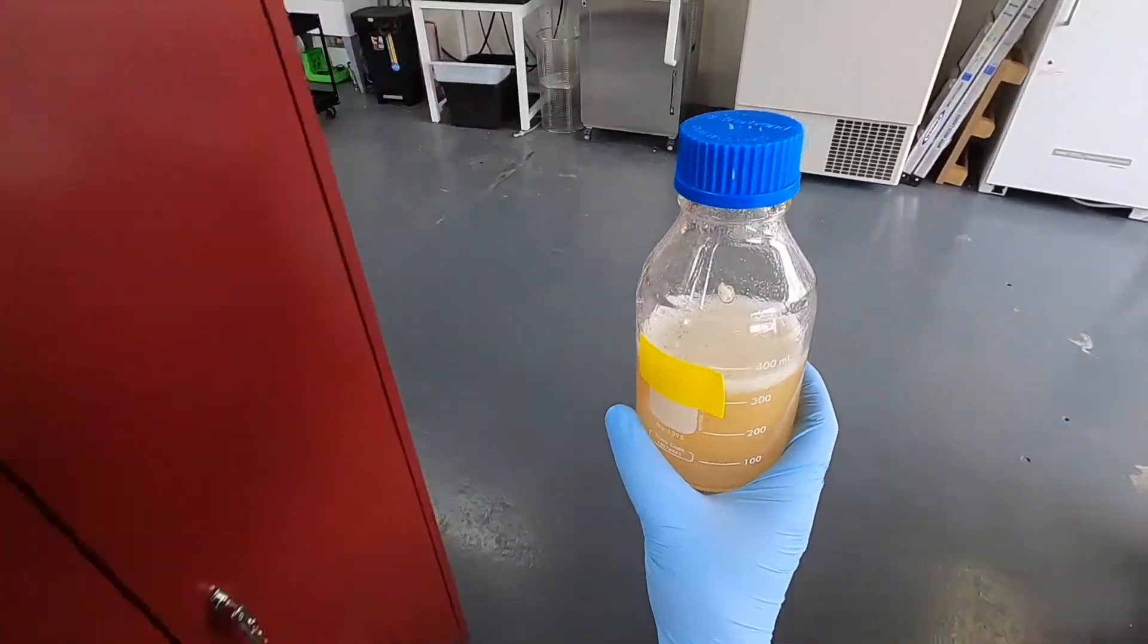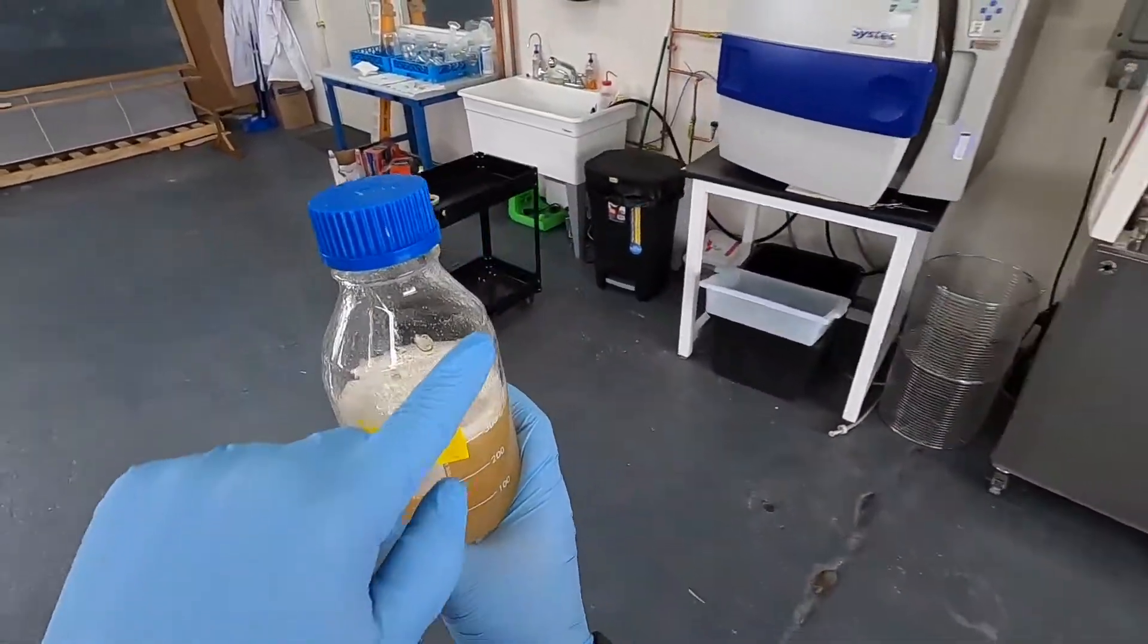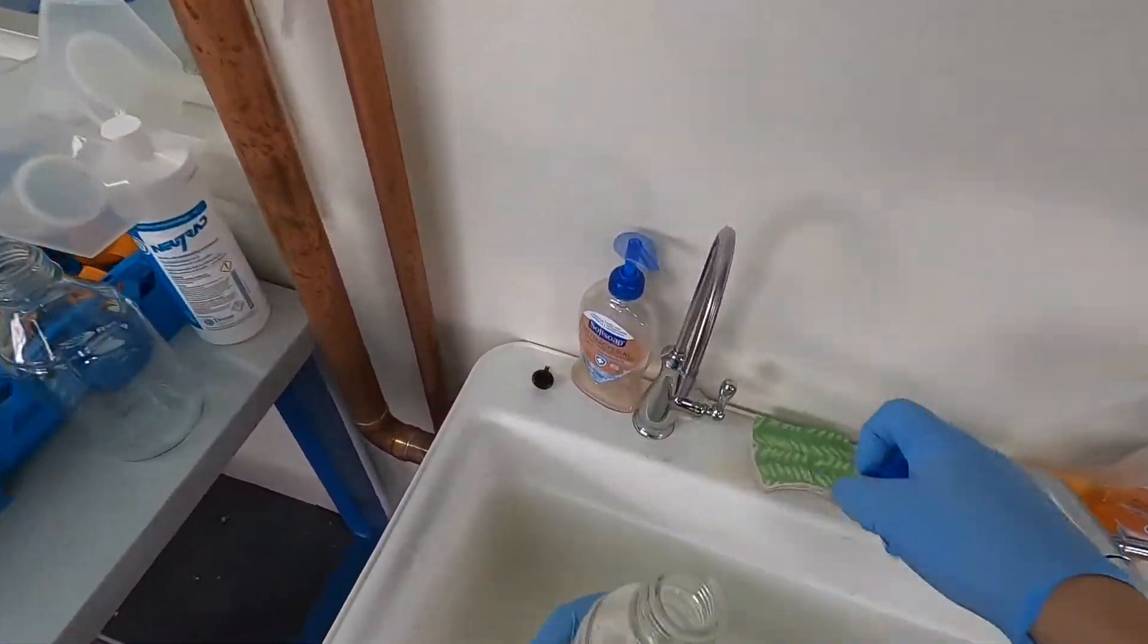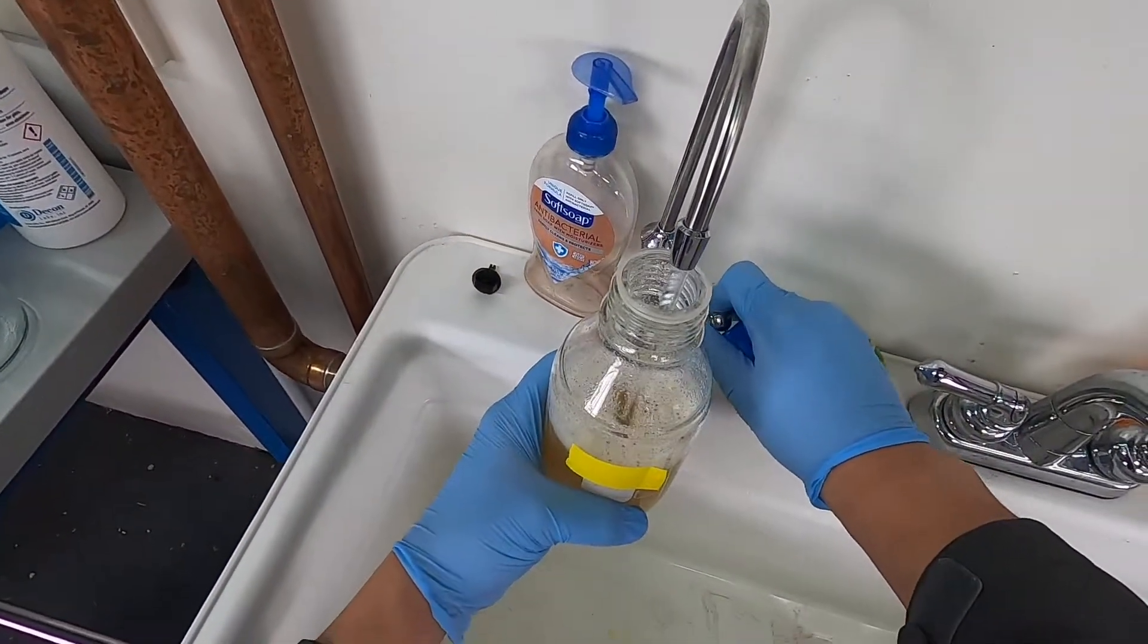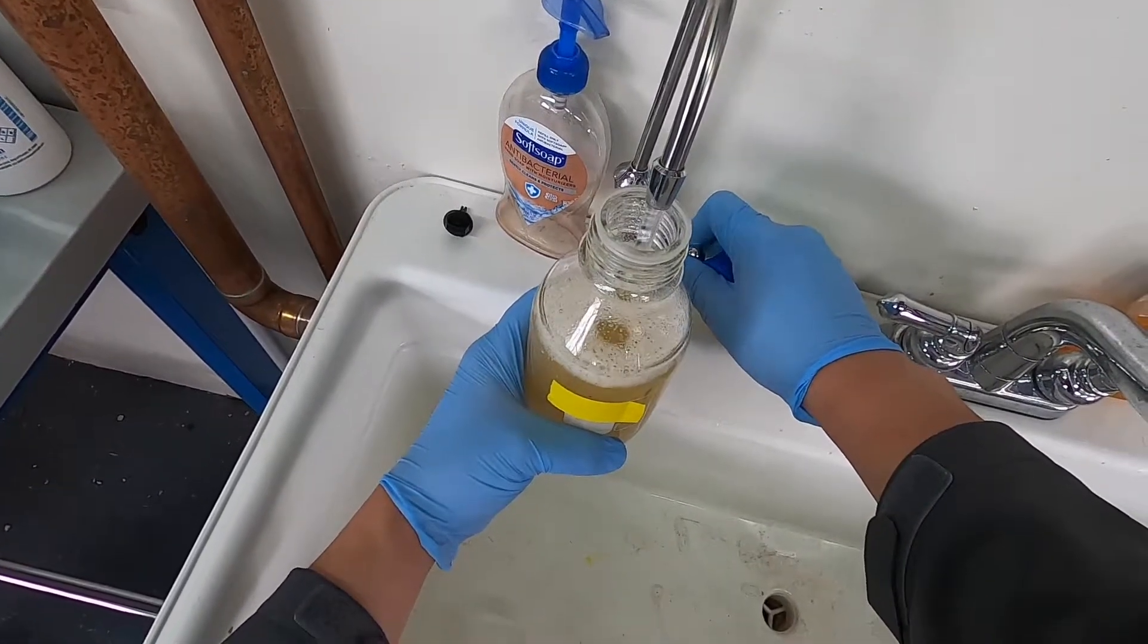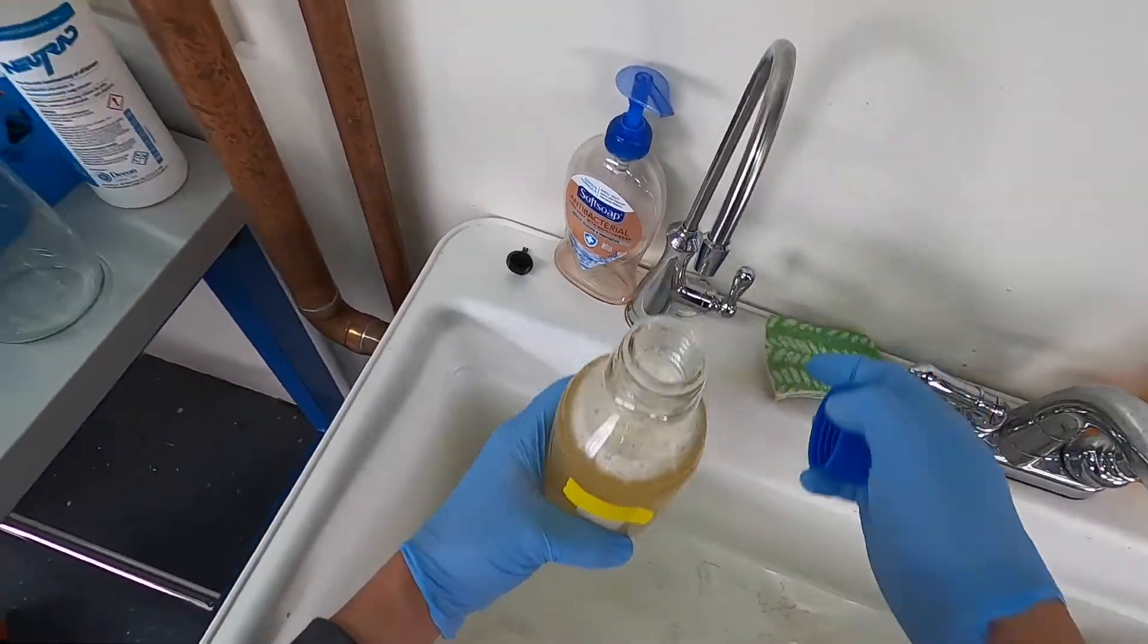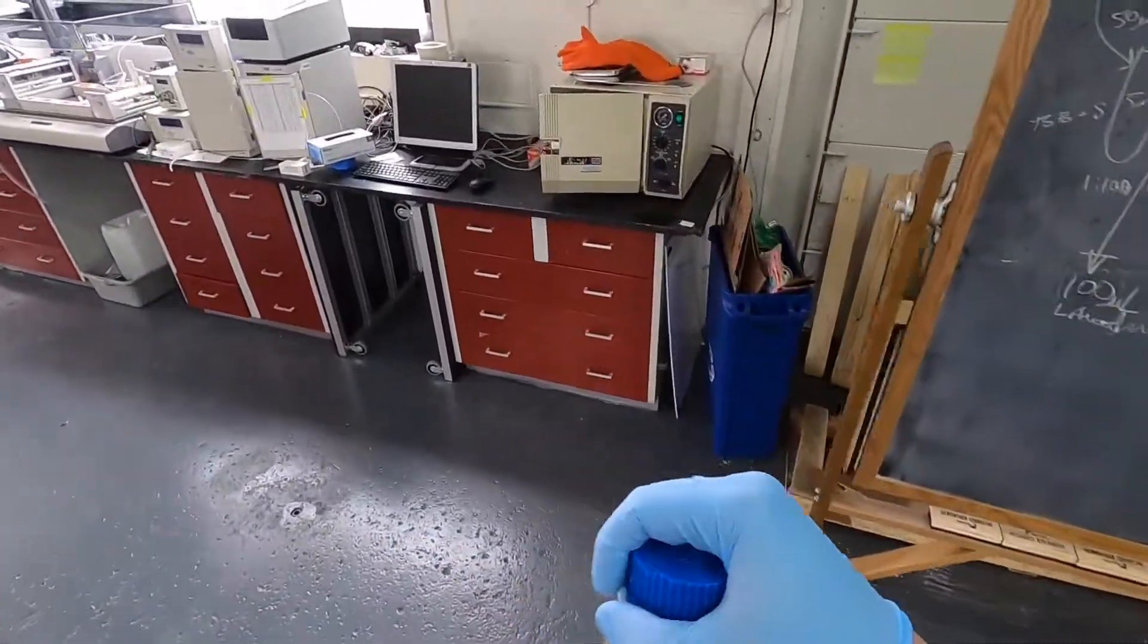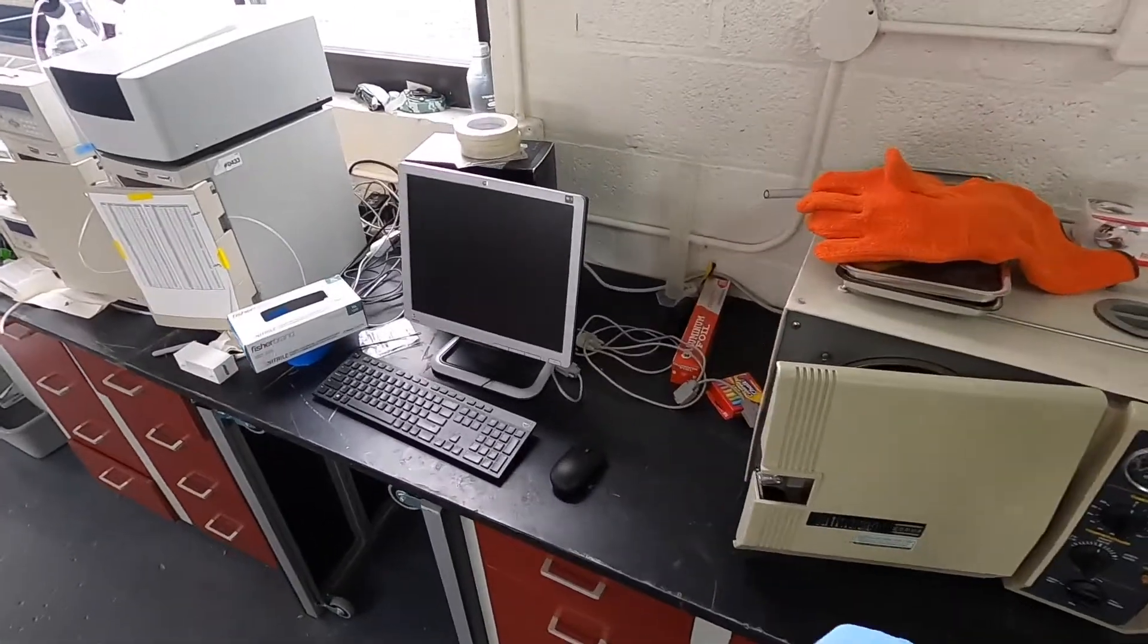So we'll top this up to 500 mils, which is this first bevel here on these media bottles. And generally I go a tiny bit over because there will be a little boil over.